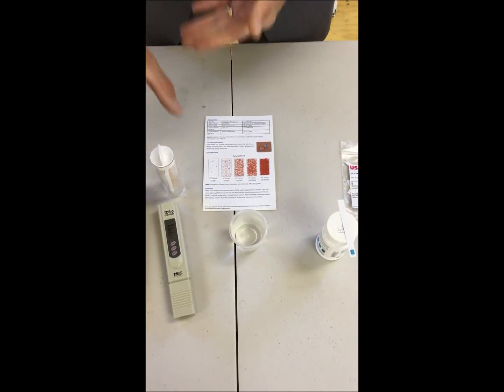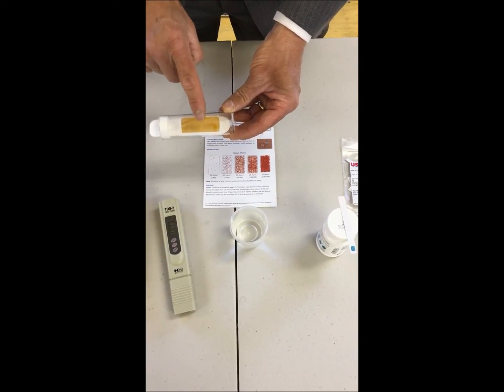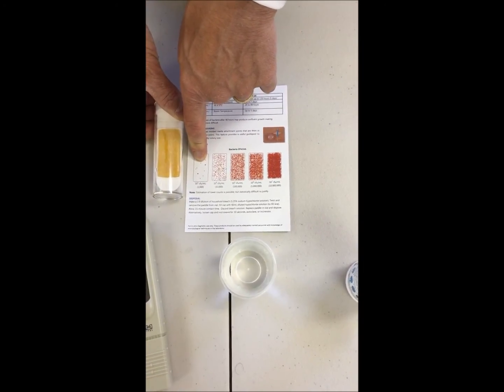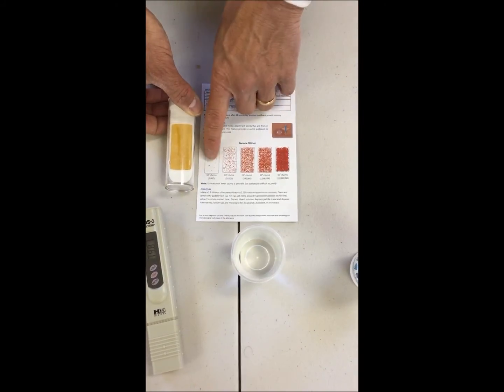So put it in an office, someplace where you know the temperature stays about constant with room temperature. Once I see the results, the next day, 24 hours later, I would compare the number of dots on here to the number of dots on this chart. So if it looked like this, for example, I would record 10 to the 3rd colonies. There would be no action to be taken because I'm in good shape at either 10 to the 3rd or 10 to the 4th.